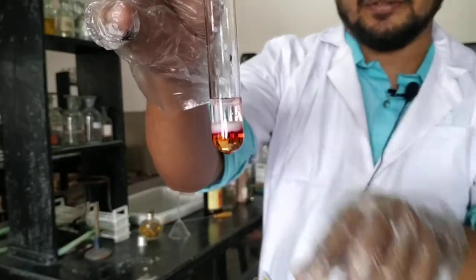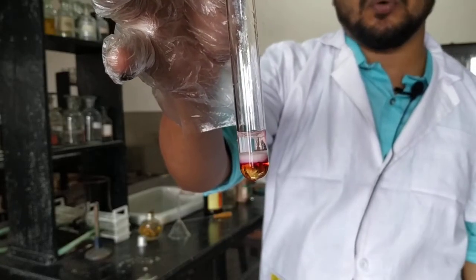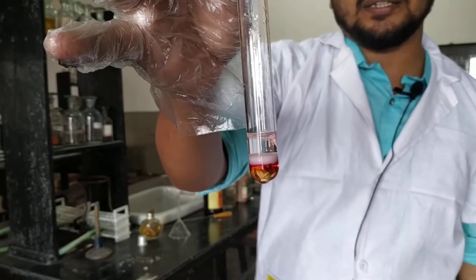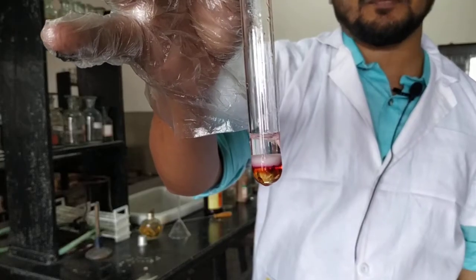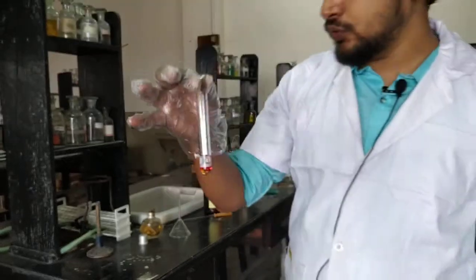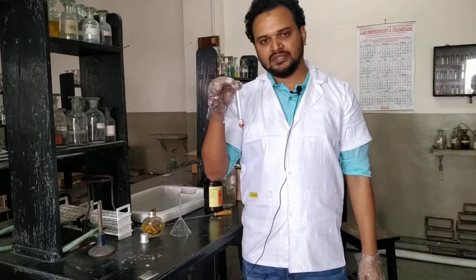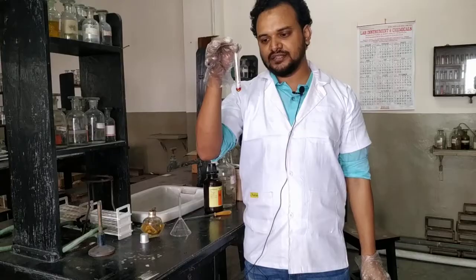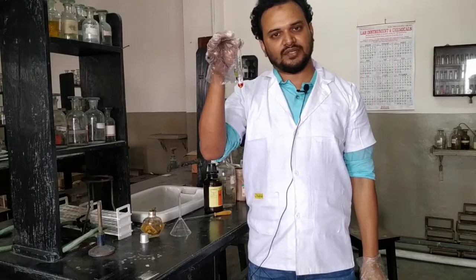The transparent part is the unreacted portion, because we added the H₂SO₄ very slowly along the walls and did not shake it — we don't want to break the ring. If you shake it vigorously, the whole solution will react and give a reddish-pinkish solution overall, but there will be no ring. So it is very important to very delicately and slowly add the H₂SO₄ along the wall. The observation: a red ring is formed at the junction of the two layers, while the aqueous layer forms a white precipitate like cotton. This test is complete.